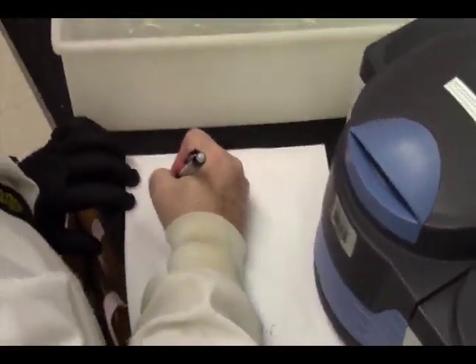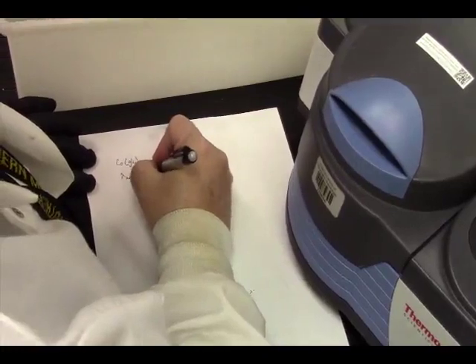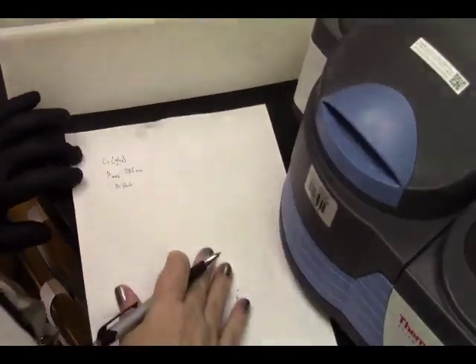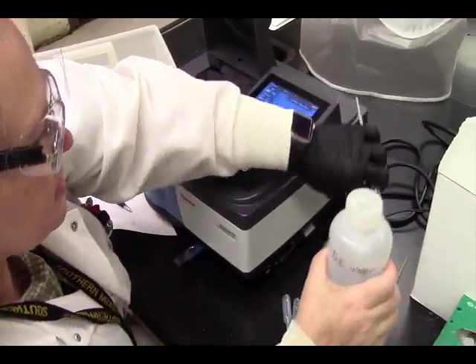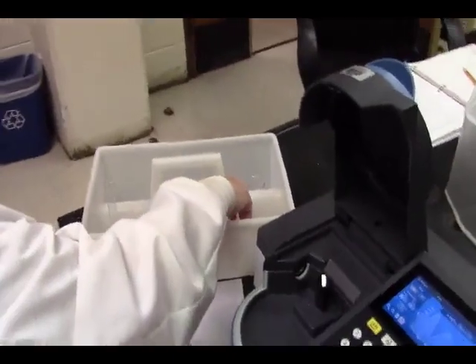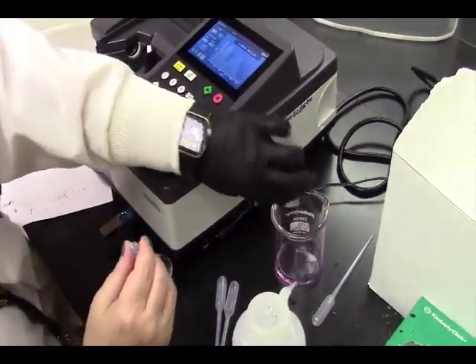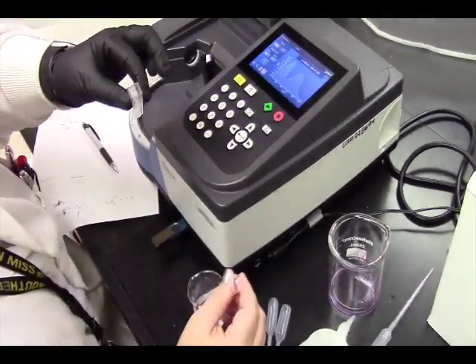Just in case something happens with the data, we've got our cobalt glycine at a lambda max of 385 nanometers, and it is an absorbance of 0.366, although I don't know the absorbance is going to matter for us as long as it's okay. Waste beaker. We need to rinse this between, because we're not doing a standard curve with the same compound. We're doing different compounds, so we need to rinse our cuvette in between, with your next compound that you're going to take a UV of.